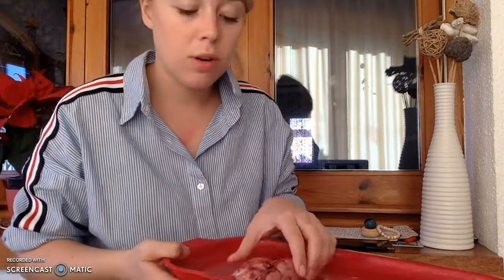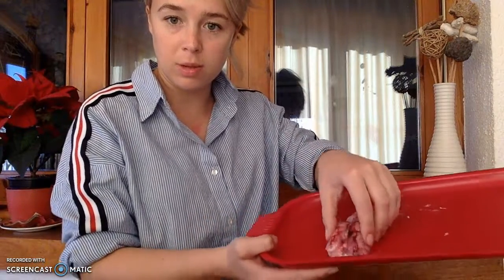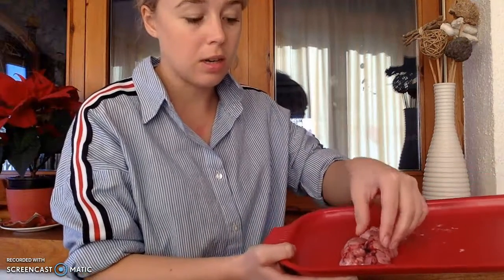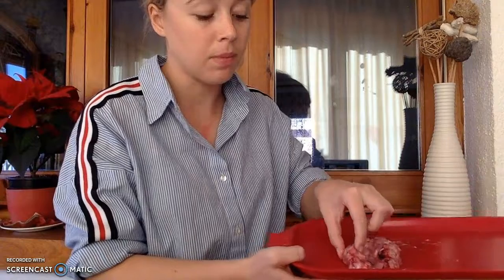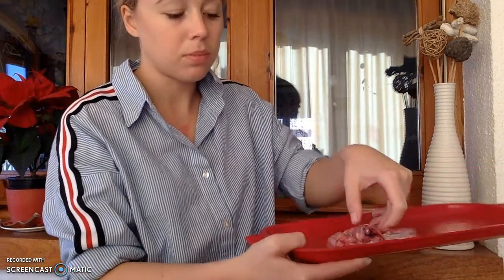Okay. So what separates the two hemispheres? At the moment, I'm holding them together with my finger, but normally what holds the hemispheres together is this, and now this is where we're going to separate them, is this white matter right through here, and it's the largest white matter of the brain, called the corpus callosum. So that is right where my thumb is, right there.